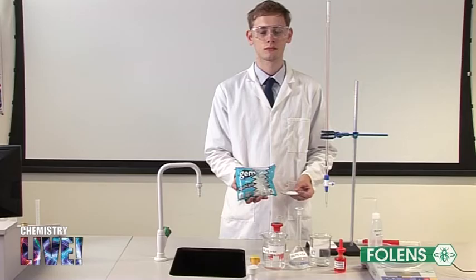From the results of our titration, we will work out the percentage of water of crystallization in the washing soda.